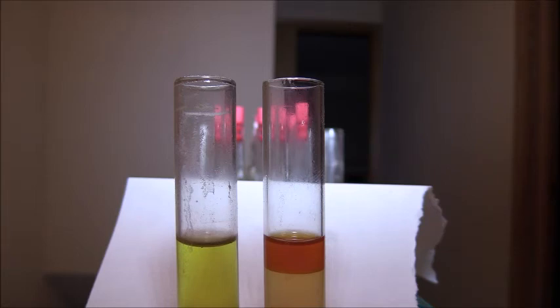Although it is possible that this is simply the meniscus of the liquid, I really don't think that's the case. I studied it and it is definitely a different color than the rest of the liquid.